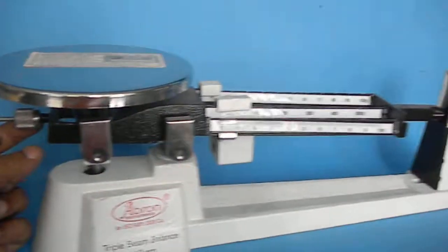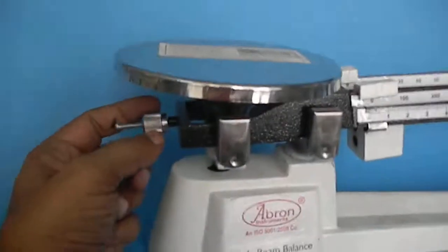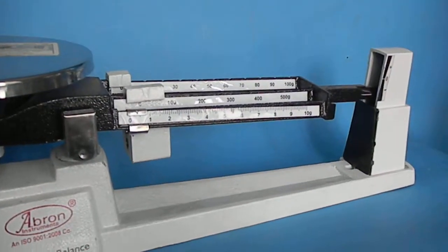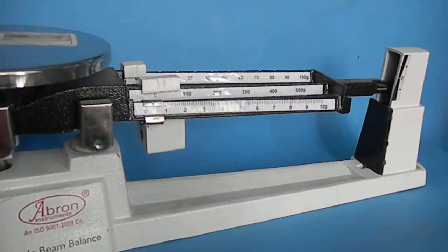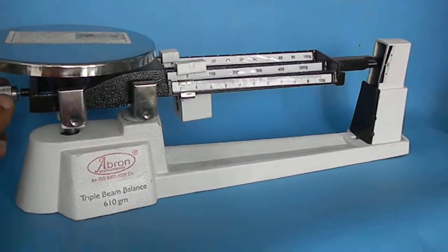This is the working we have given. There is one screw for balancing. You just change it. If you change this, this keeps on moving up, and this is for balance.